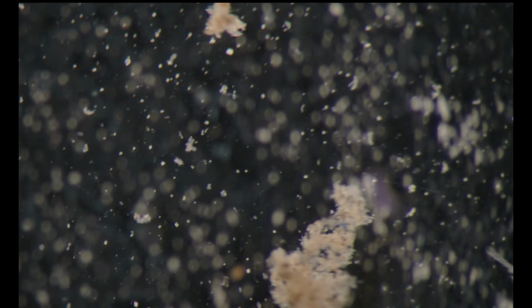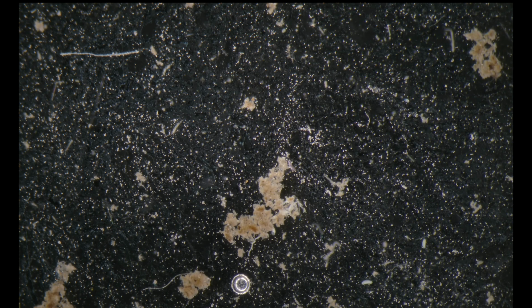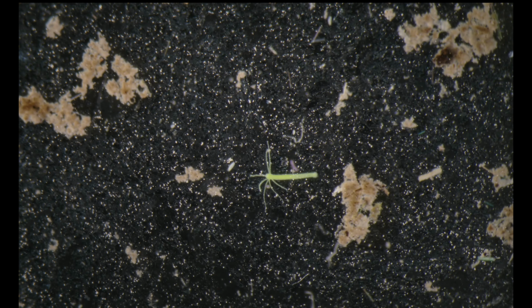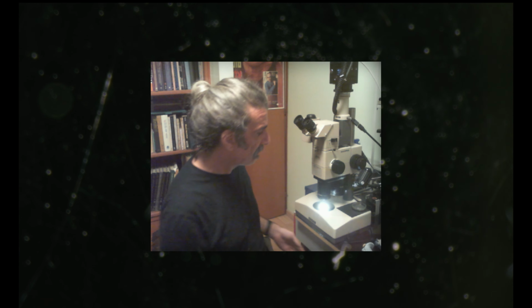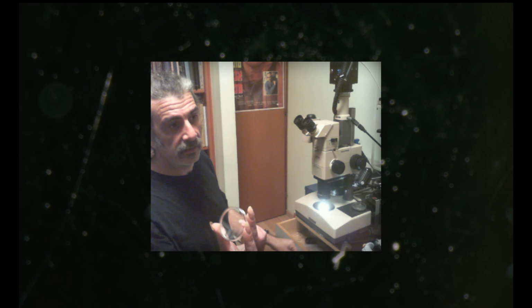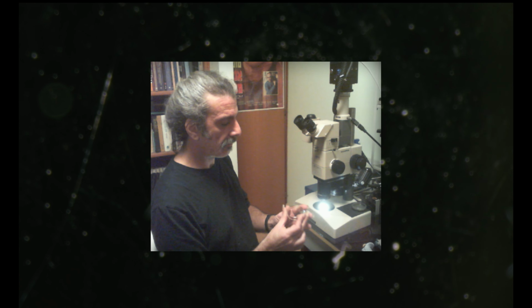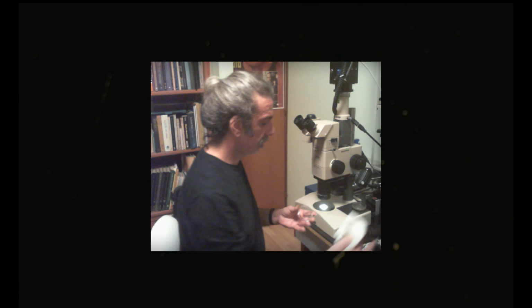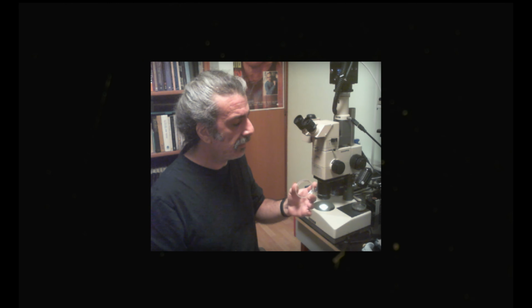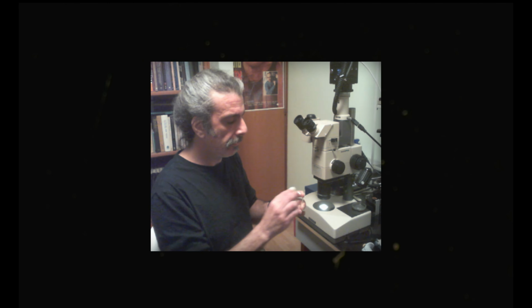Okay, haven't found here. It's very dense, the top layer is very dense, so our viewing is very disturbed. I'll take a fresh sample now. So I'm taking a new dish. I use the top lids as well. They're perfect for that. A little cleaning.